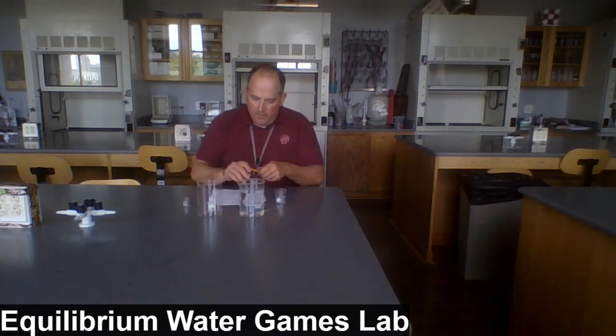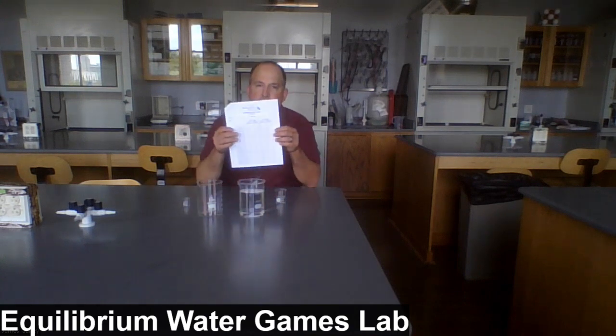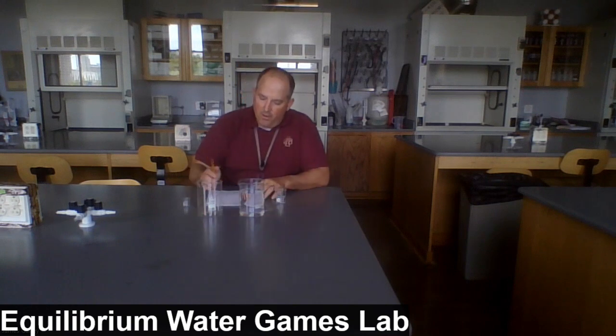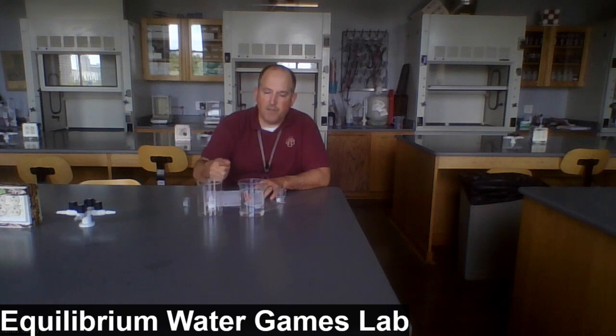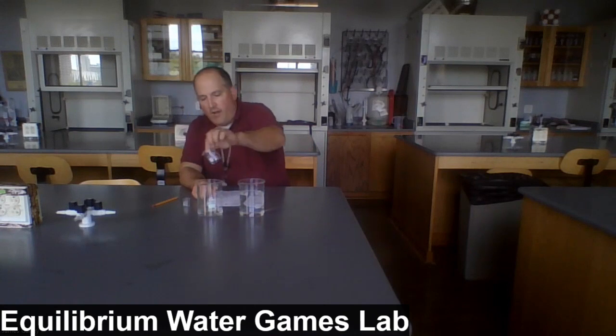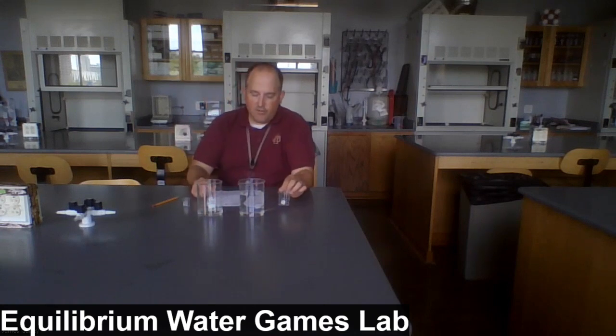In part one data, we're on the left side. The initial volume of water in beaker A is 500 milliliters. We have 0 milliliters in beaker B. This one's empty. This one's got 500 mils of water. Now we're going to dip. You can dip your transfer beaker in as much as you want and transfer water over. Try to minimize splashing, but we understand if that happens, it happens.